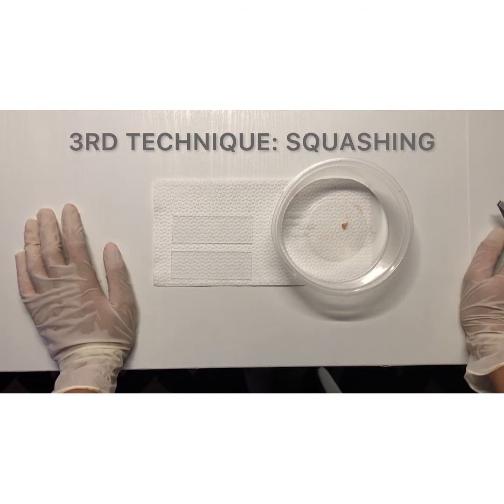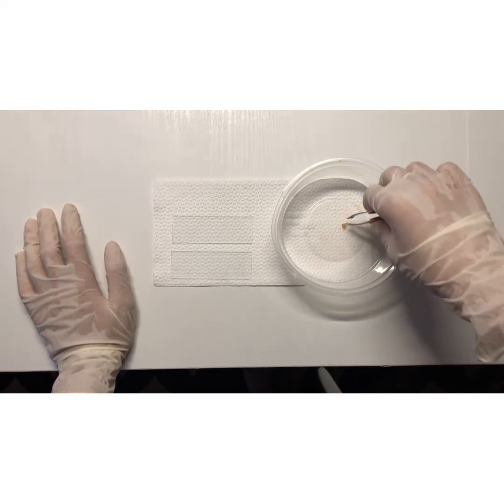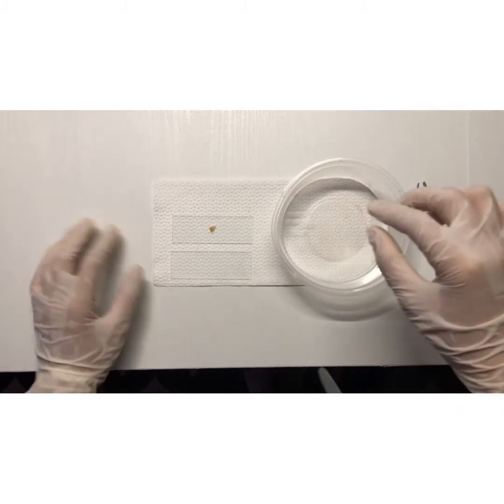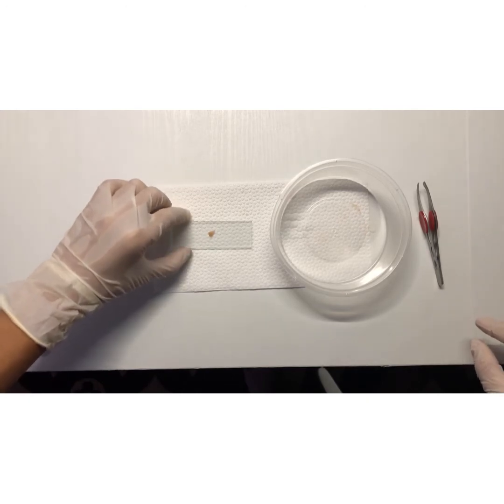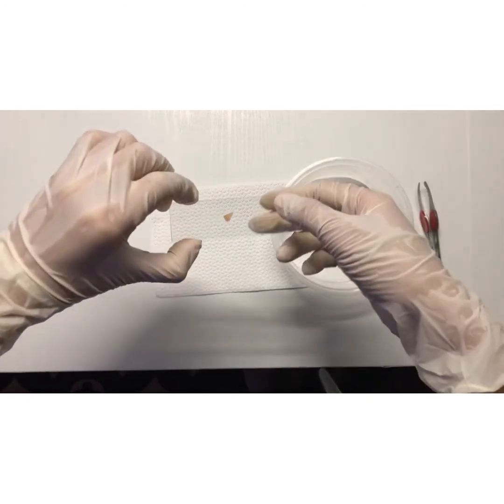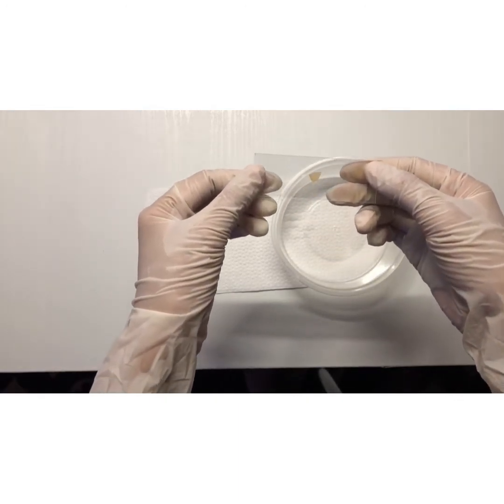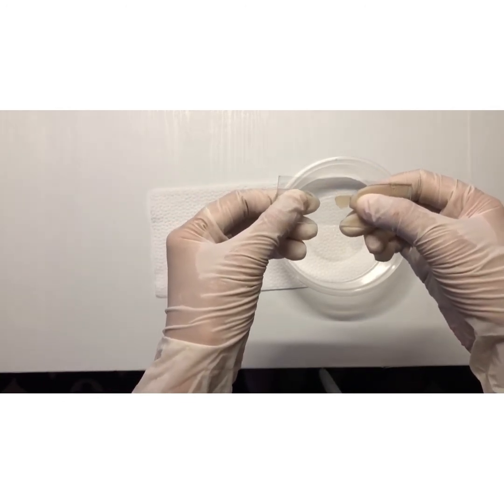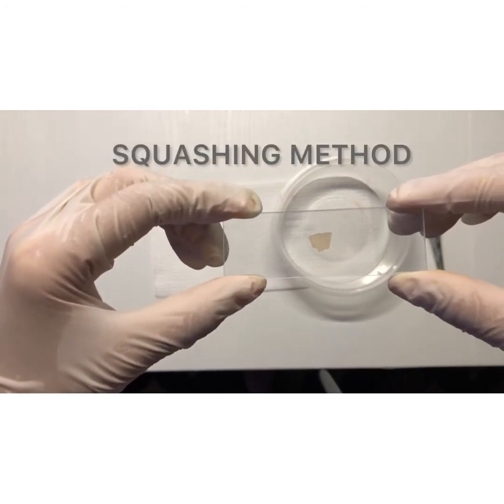So first, I will be placing my tissue specimen on the microscopic slide, and then I will cover it with another microscopic slide. Then, I will crush the tissue specimen so that it will be flat. So this is now a squash preparation of tissue specimen.